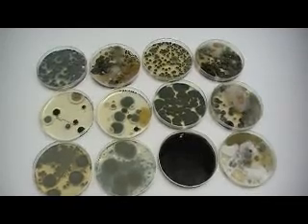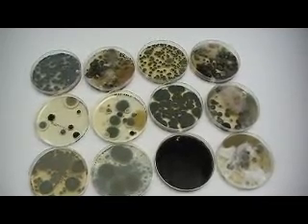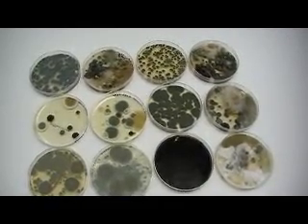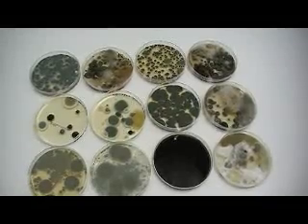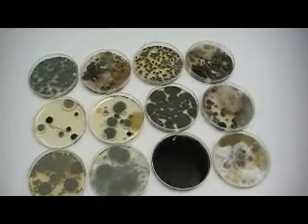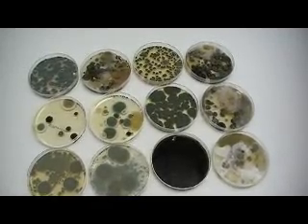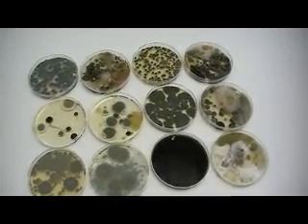These are different types of moulds grown in the laboratory. As you can see, some of them are black, others are green, others are white, and others appear to be yellowish or brownish. So, moulds come in different types of colours.